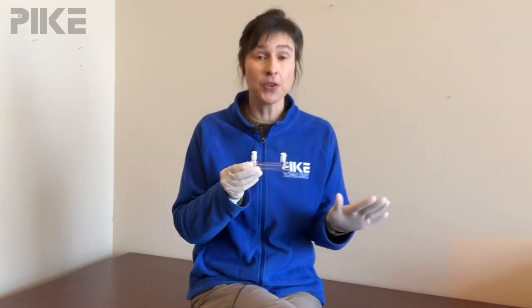If you need a transmission cell, these will transmit from the UV to the visible to the near-infrared to part of the mid-infrared. So anything in that region up to 2,000 wavenumber is fair game for these.